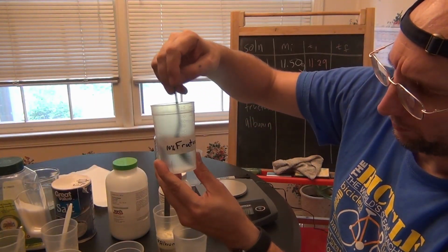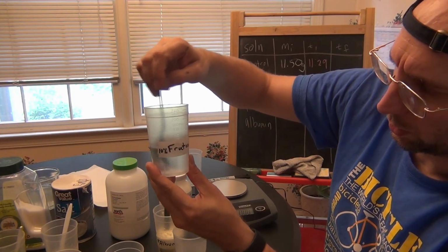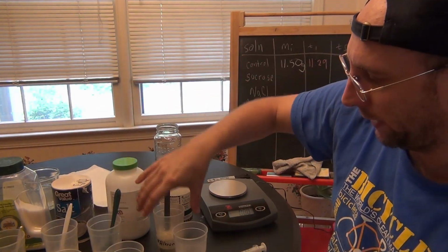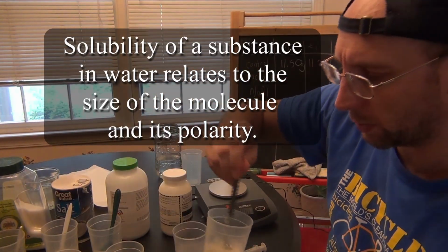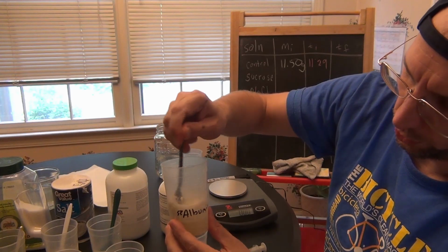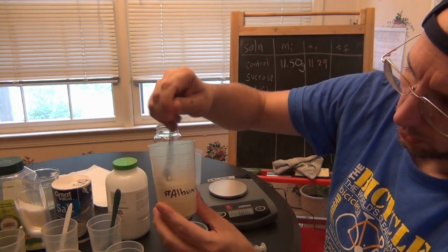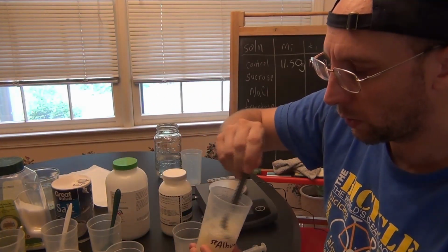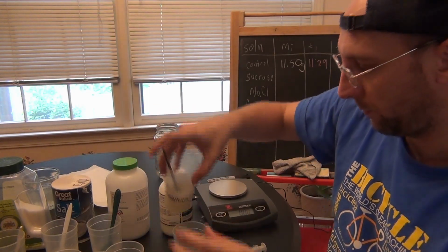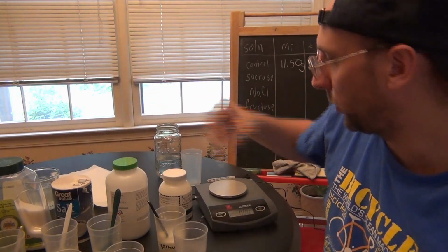Fructose, pretty much already in solution. And albumin, well, albumin's going to be a pain, and I'm not going to worry about it too much. It's pretty good. Okay, so back to sucrose.